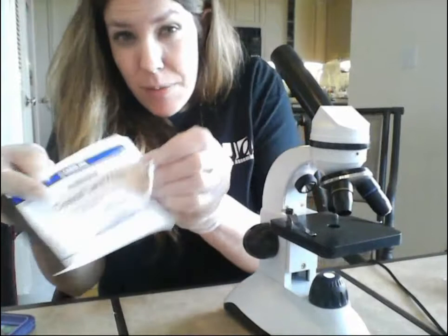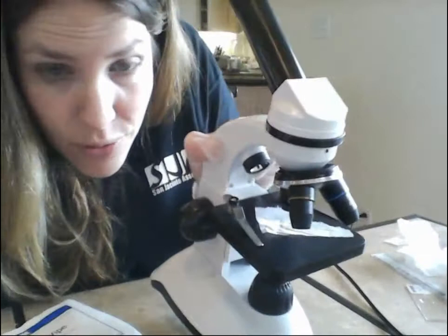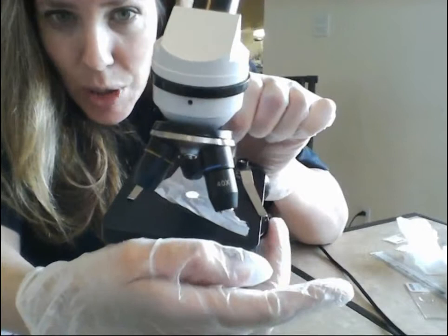Another thing you should try for practicing the iris diaphragm: take a little piece of lens paper and you'll see a little circle of light. If you change your iris diaphragm, you'll notice how the diameter of that circle of light changes — it gets bigger or smaller. Just play around with that to get an idea of what your iris diaphragm does.